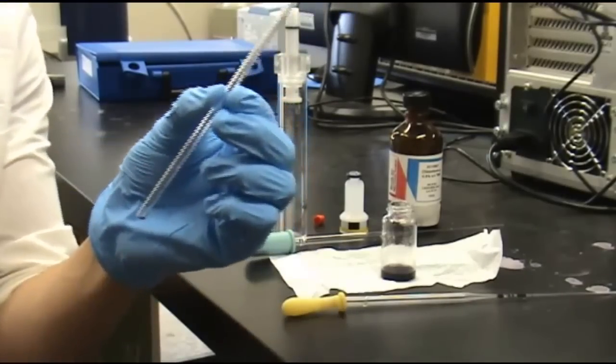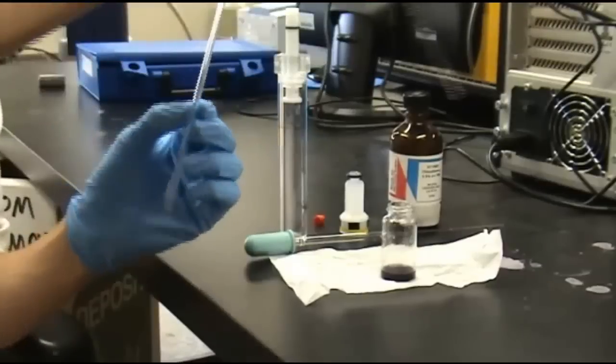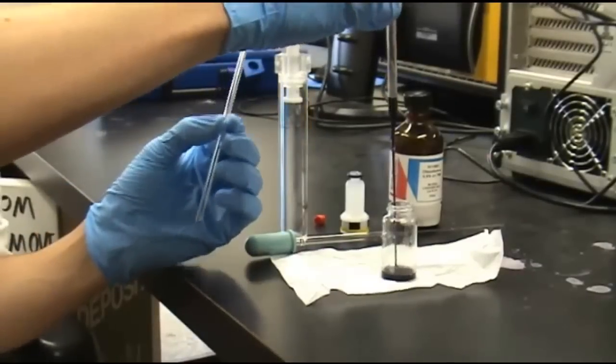The first thing you'll need is an NMR tube. Next, using a Pasteur pipette, draw up some of your sample.